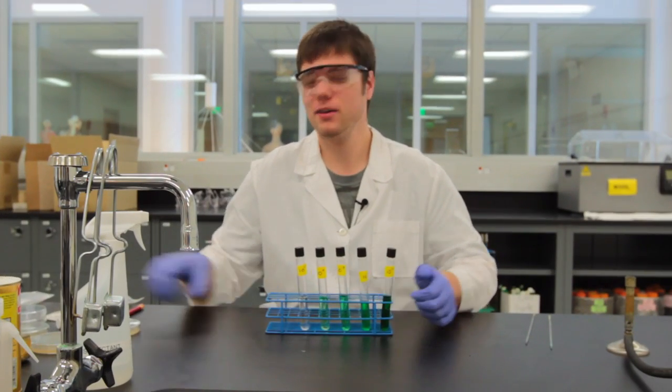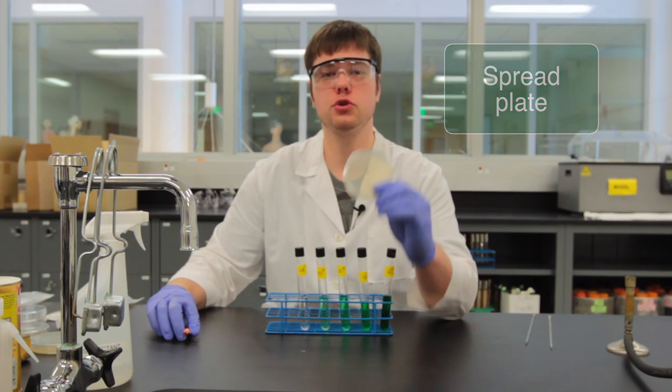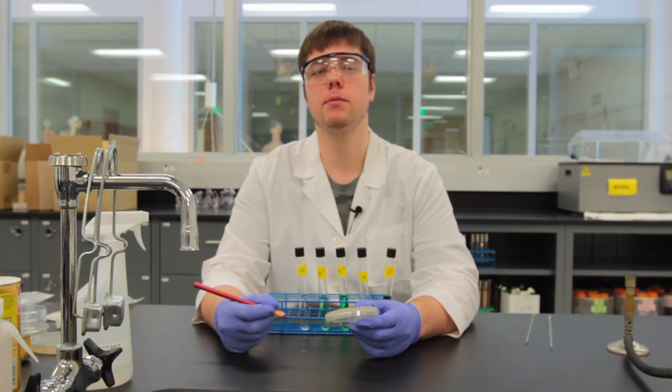We will be doing what is called the spread plate method today. We want to make sure that we've got our nutrient agar plates already poured and we're going to label them appropriately.